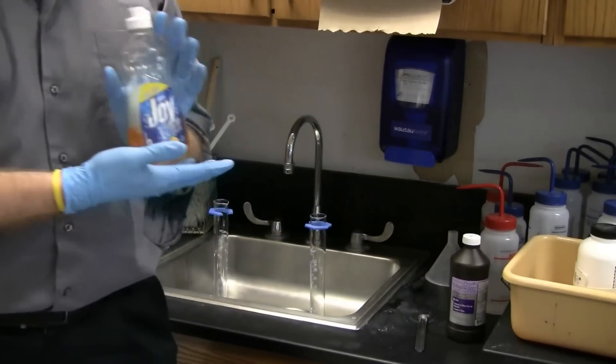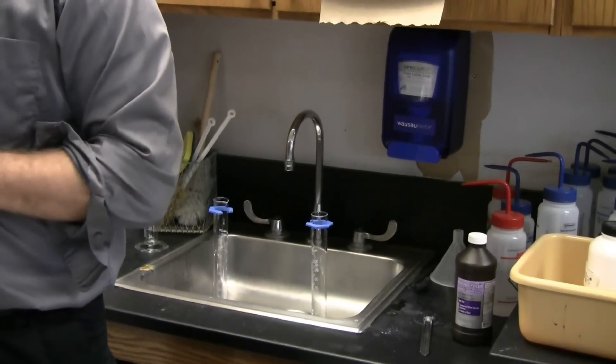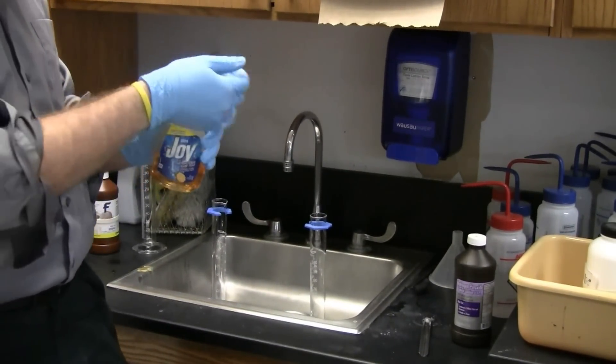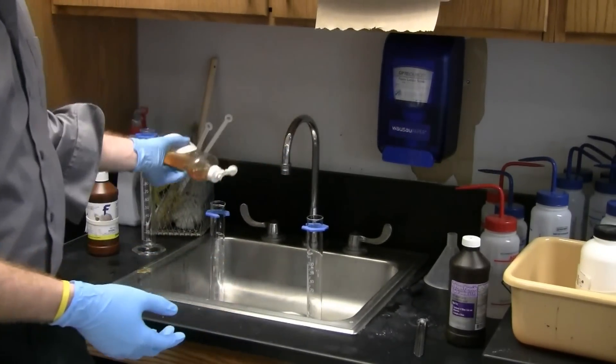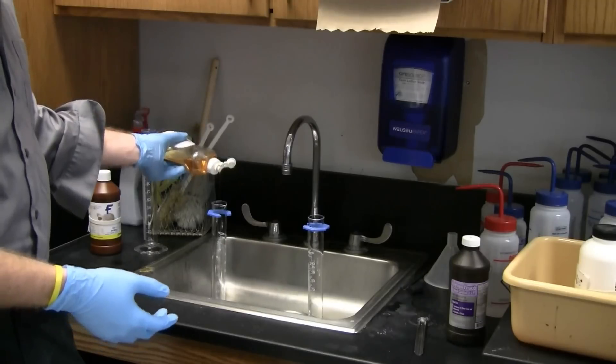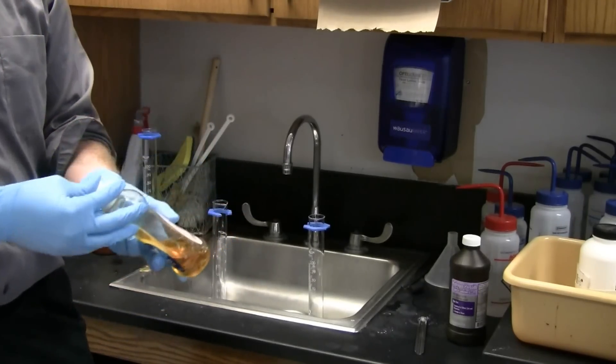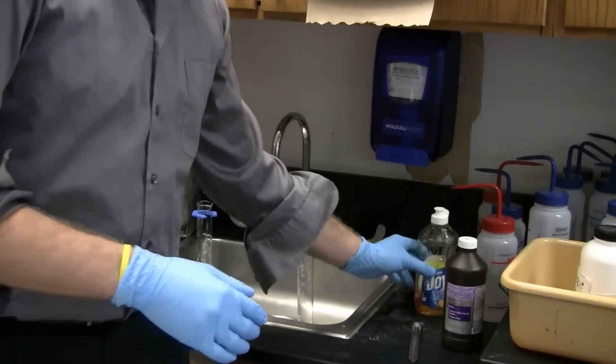And then we're going to add a magic ingredient. So we're going to add some nice dish soap. All right.